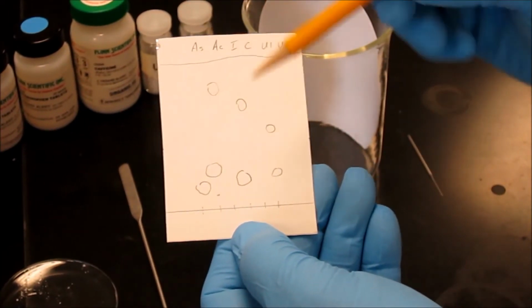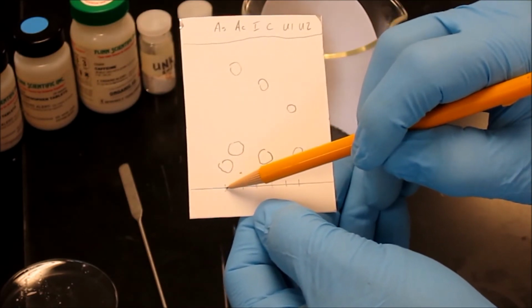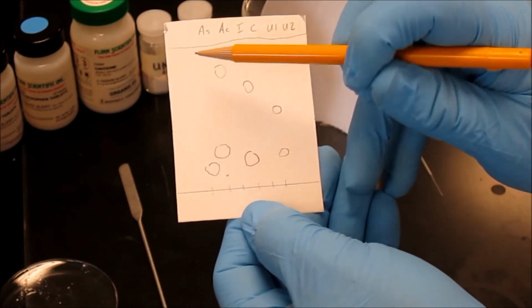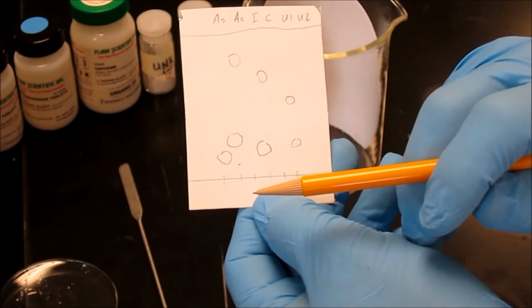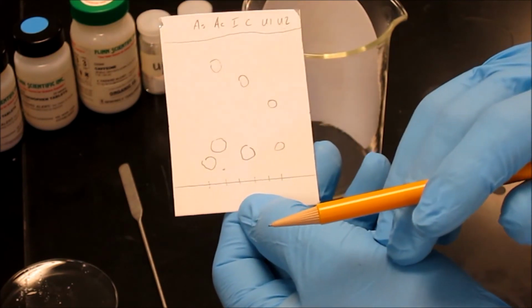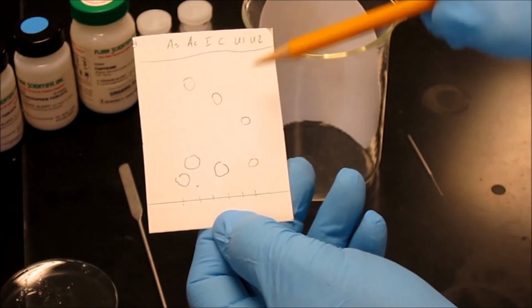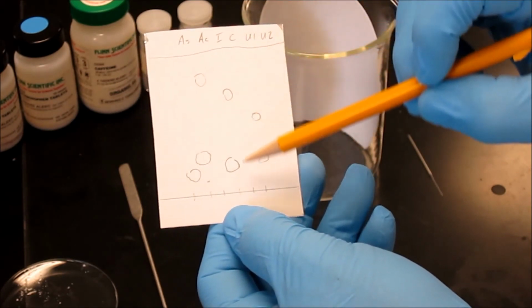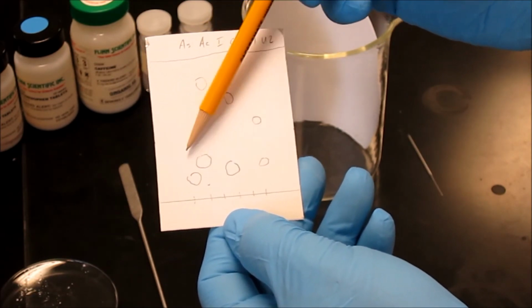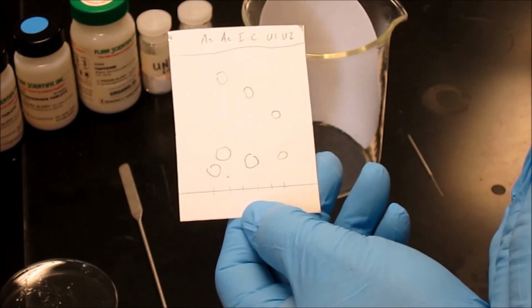Alright, now that I've marked my analytes on the TLC plate, I can see that this analyte traveled from the origin point to here, and that the solvent traveled from here to here. And I want to measure those distances in order to calculate my RF. The calculation for RF is explained in your textbook, and you will use these RF values to determine what materials are in your unknowns and identify the unknown analytes by comparing the RF values to the known analytes on this side of the TLC plate. And that's thin layer chromatography.